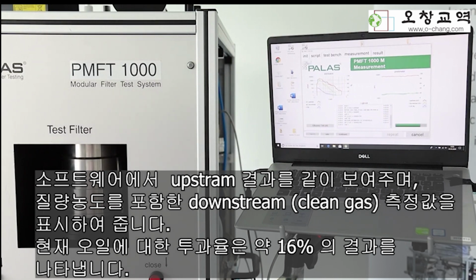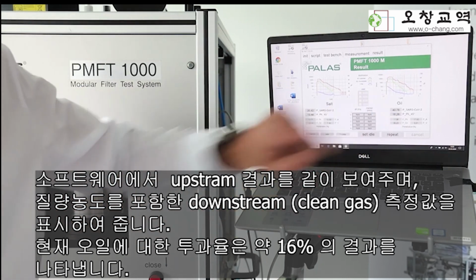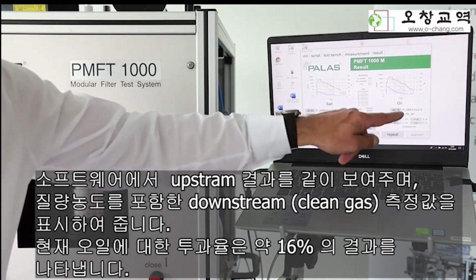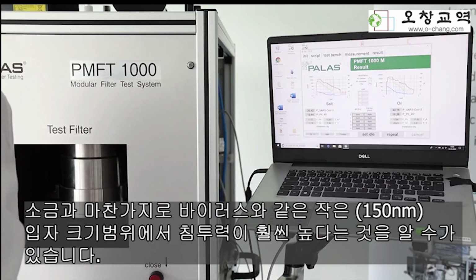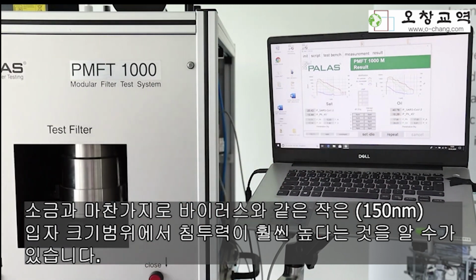After the test is done, it switches automatically to the side, and you see now here the result with oil, 16% for the photometer signal, so that would be an FFP1. 20% penetration is allowed here. Here it was close to it, it was FFP1 as well. And here you can see, again, same as with the salt, that the penetration for small-sized particles like viruses is a lot higher by number.